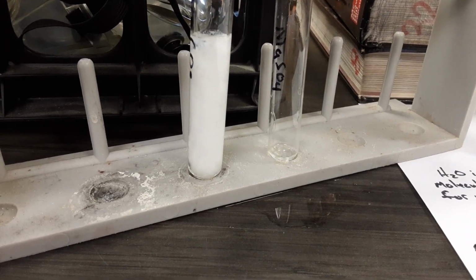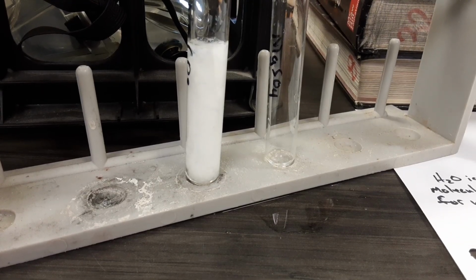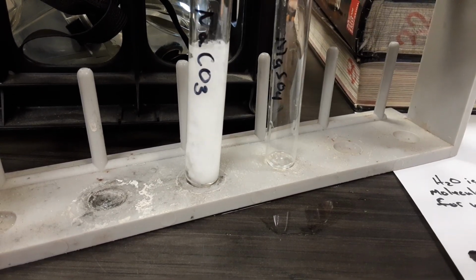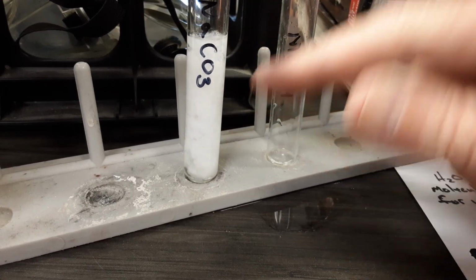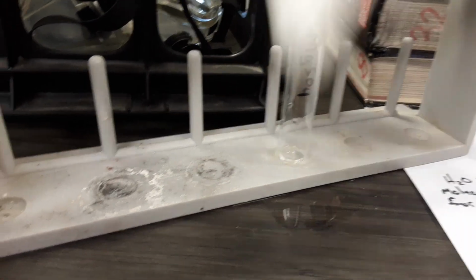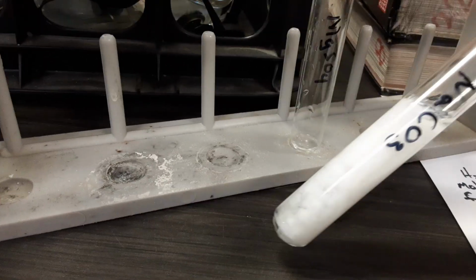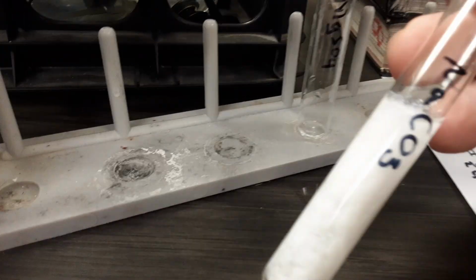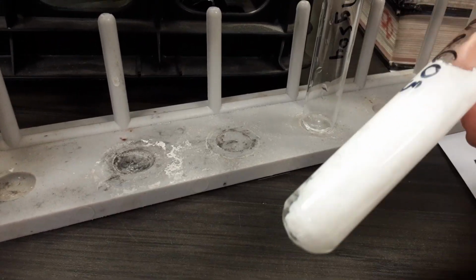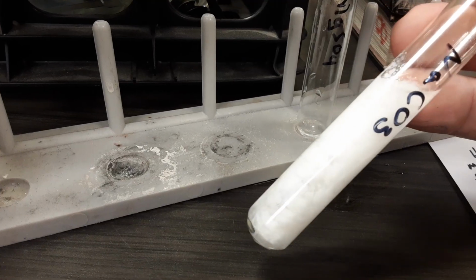Now, another clue, besides the energy change, which we decided was not a chemical reaction indicator, what we notice here, two things. We've got a color change, plus we have a new material inside of our test tube that is not sodium carbonate or magnesium sulfate, but it becomes a new substance. And I got to ask a question here, and this is the tough part. Is this new white substance soluble in water?